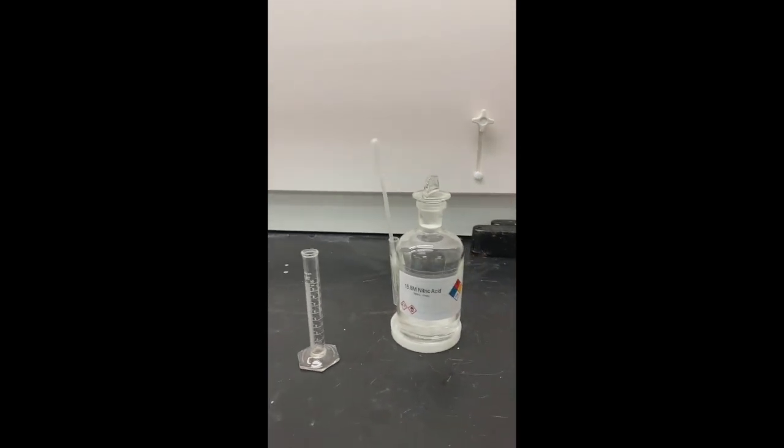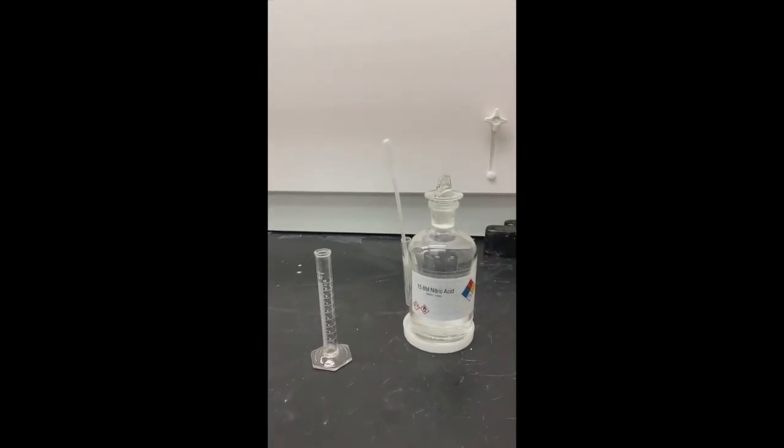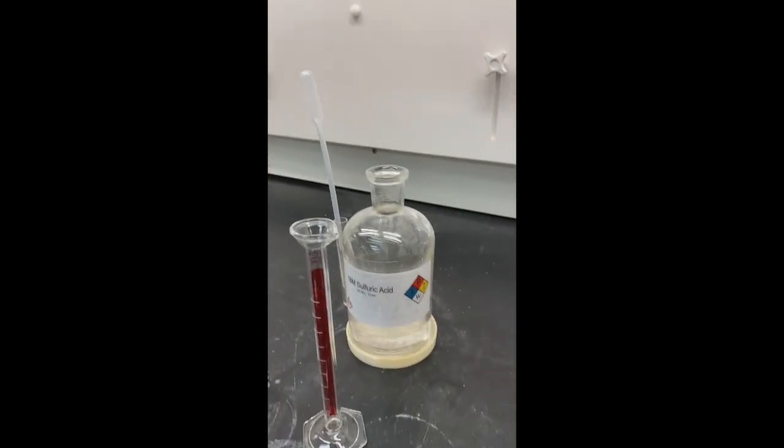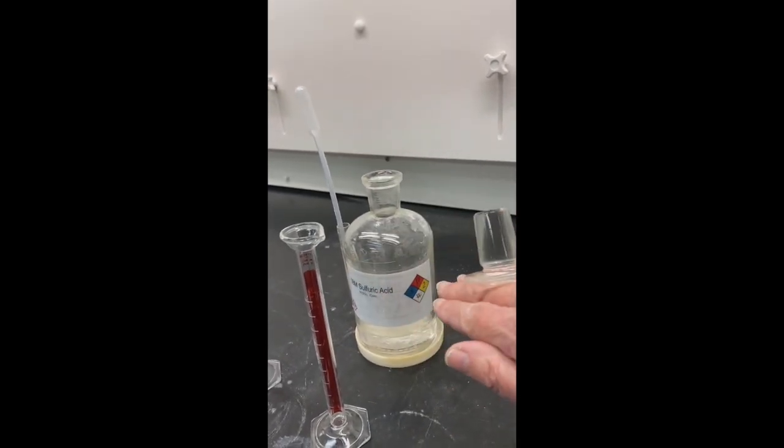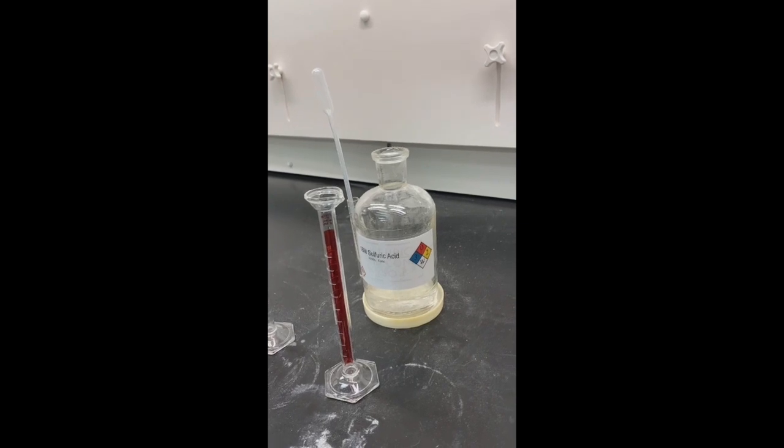I'm also going to get 3 mls of nitric acid and have that ready to go. When you get the lid off an acid bottle, don't forget to always hold it in your hand, never put it on the counter. I'm going to measure these out and I'll be back with you.